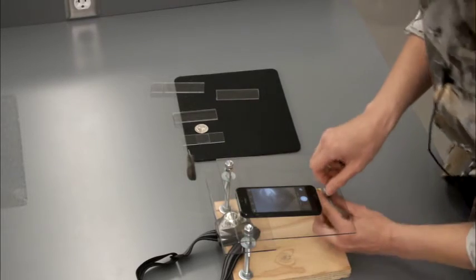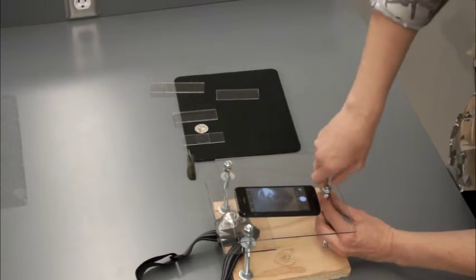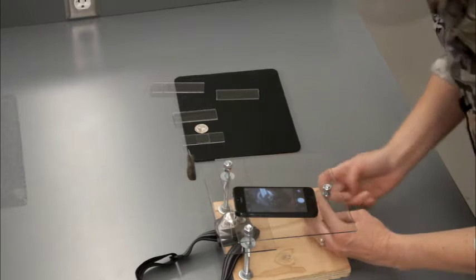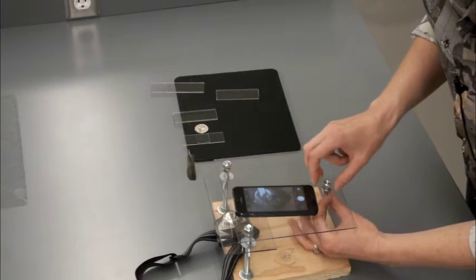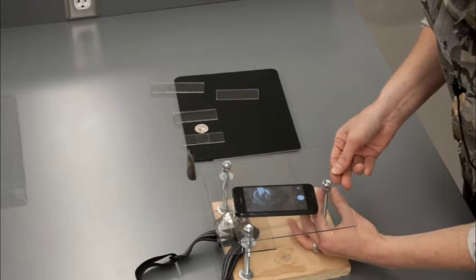And let's see, this is not quite level, so I'm just going to adjust the bolts a little bit so that our platform is a little more level. You can use a level as well.